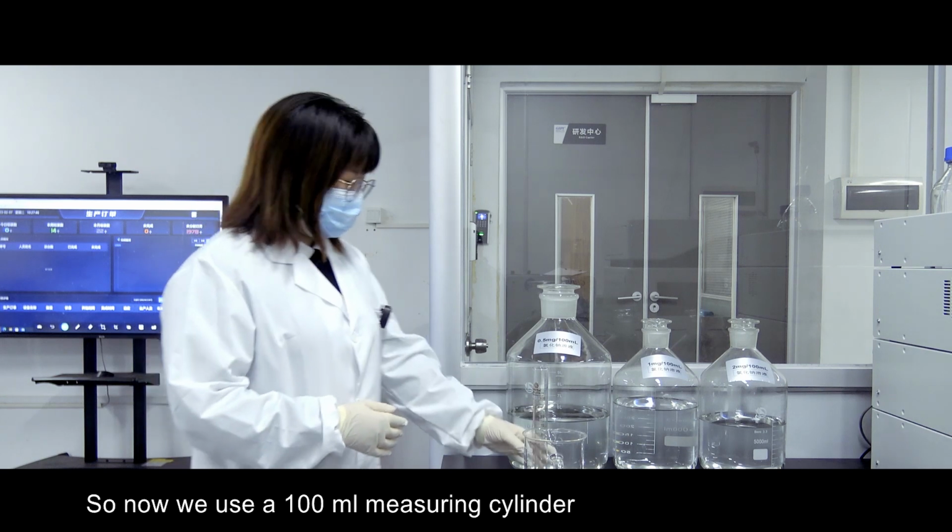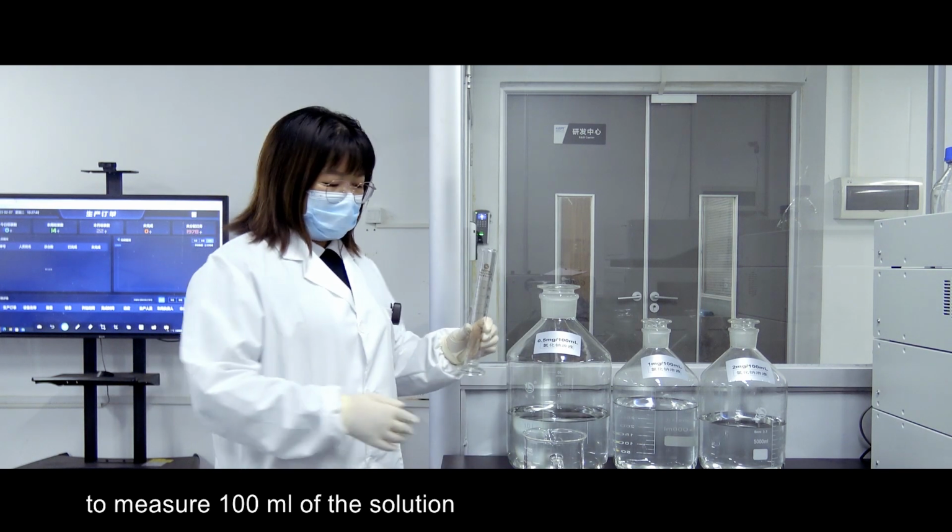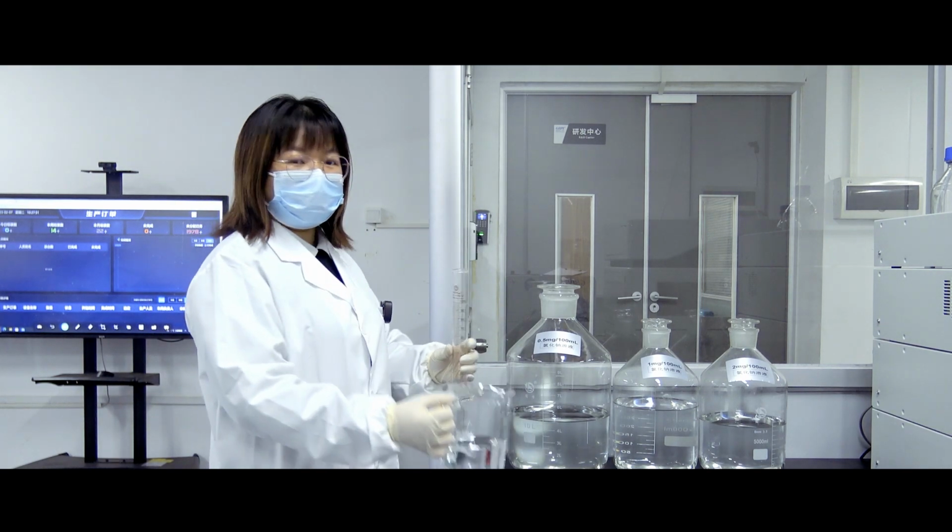So now we use a 100 milliliters measuring cylinder to measure 100 milliliters of the solution.